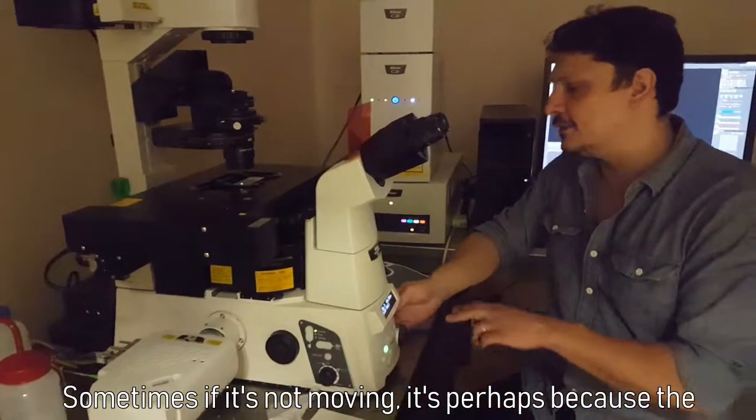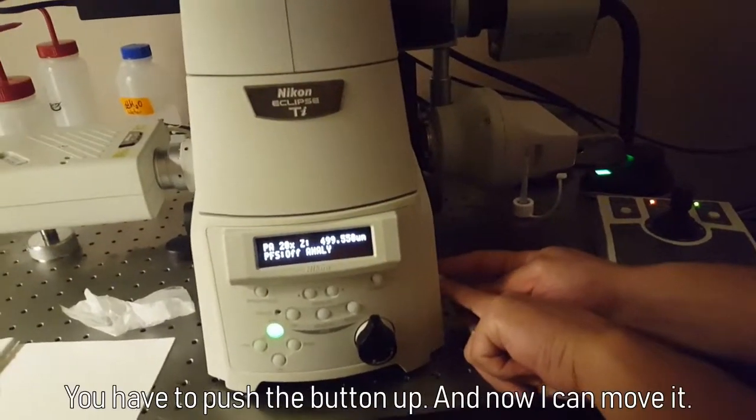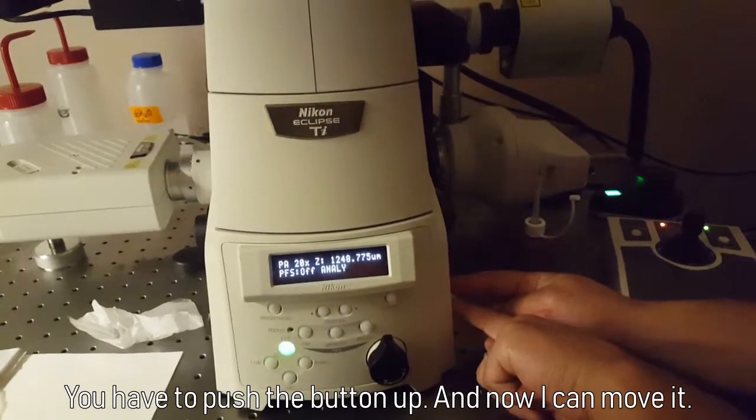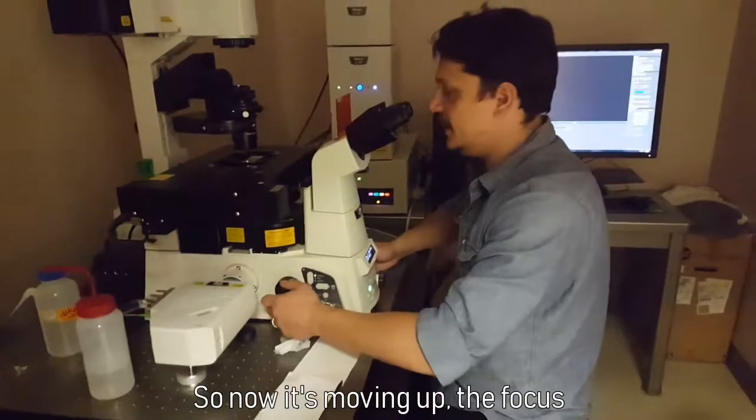Sometimes if it's not moving, perhaps because the objective is with this button down, you have to push the button up and now I can move it. This is a very common mistake I have just made it.